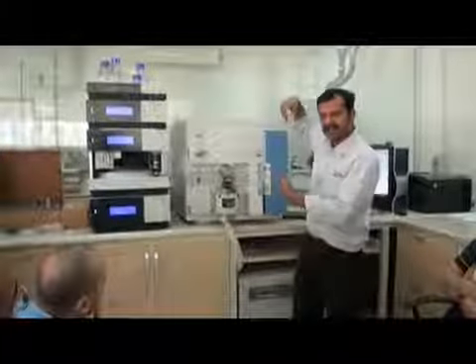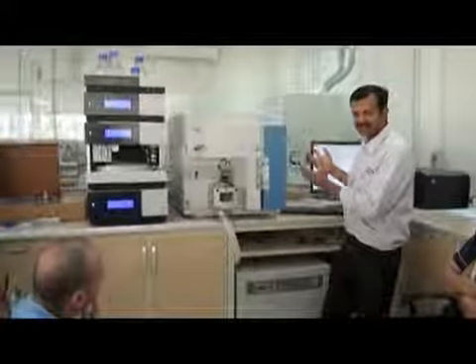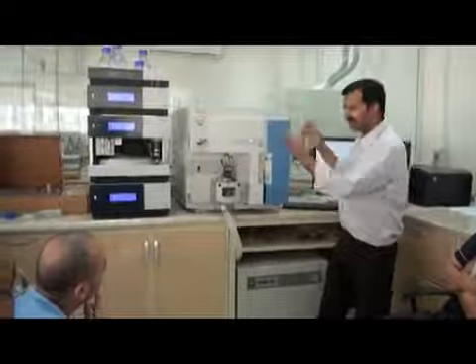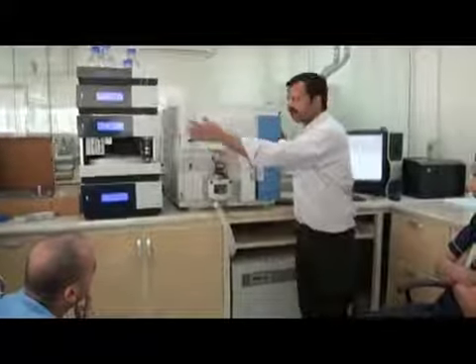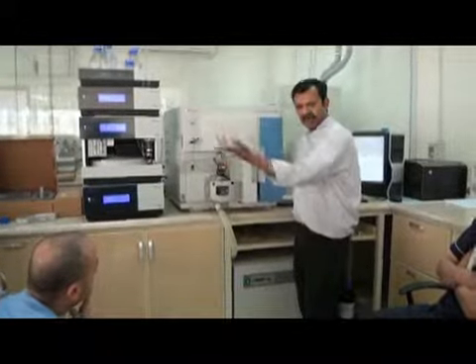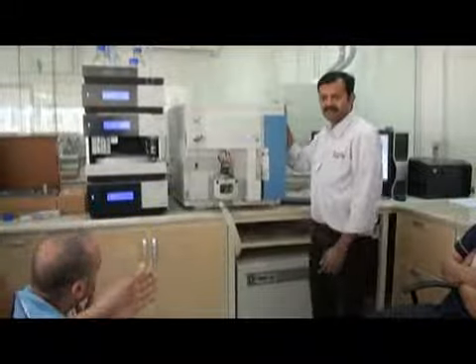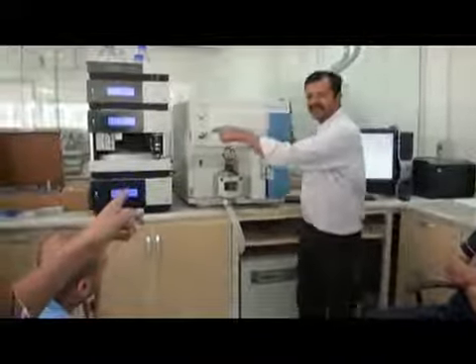If we are doing some research work, for compound optimization or some research purpose, we can make manual injection here. Don't use the auto sampler to inject. No need. We can do it manually. Also, for this it is used. So is inject used for the manual injection? This is manual injection from here.